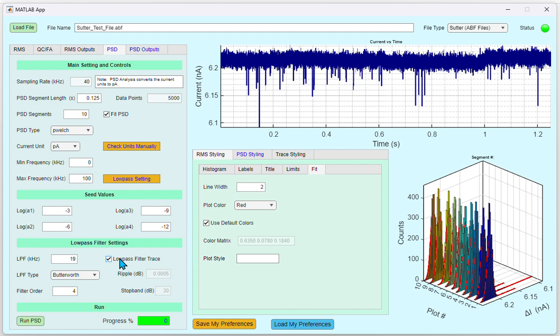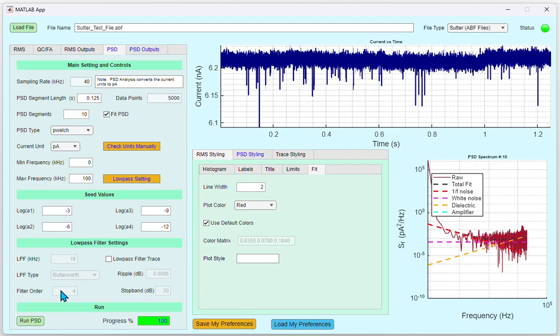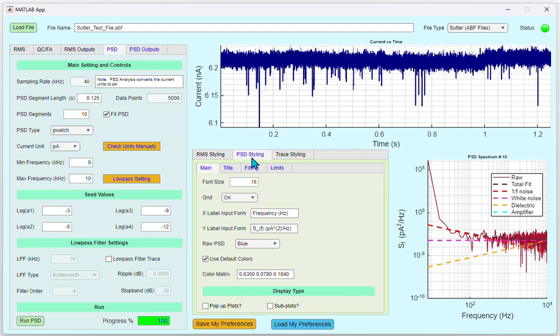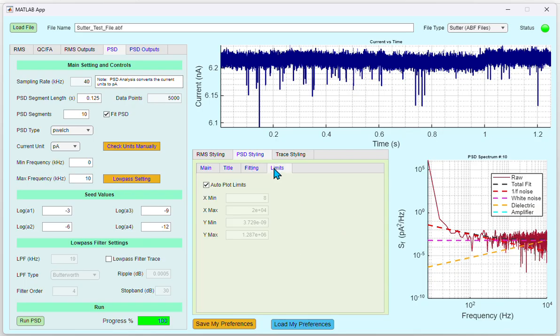Once you are satisfied with all the settings, you could click Run PSD, and you will see the progress in the Progress Percentage tab. Similar to the RMS styling, if you want to change the PSD styling, click the PSD Styling. There are a few options under the tabs main, title, fitting, and limits. These are similar to what we just discussed in the RMS styling.